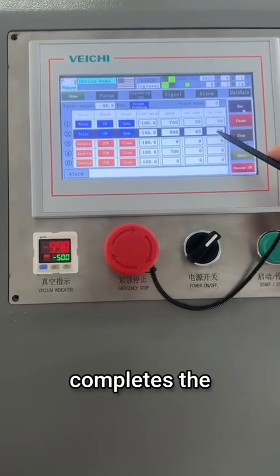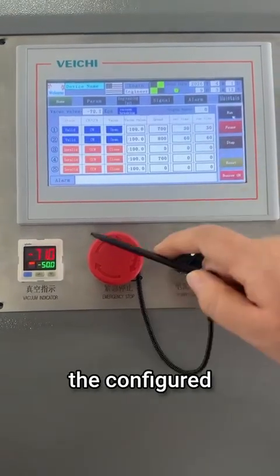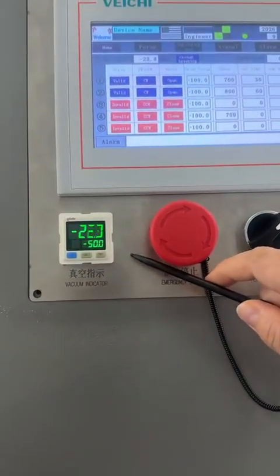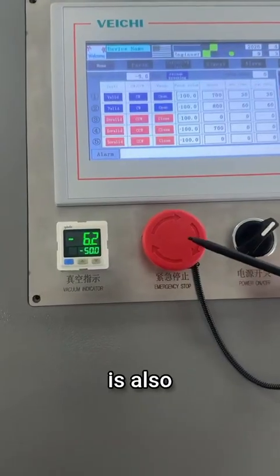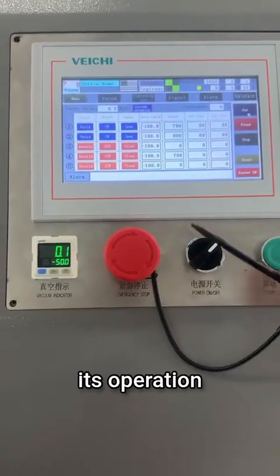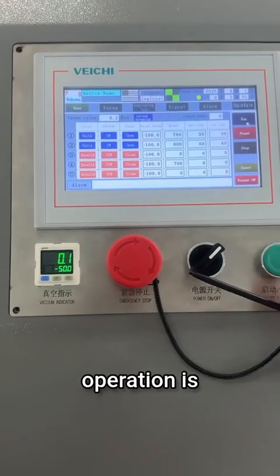Once the machine completes the preset program, it will shut down automatically, all according to the configured settings. The vacuum release process is also extremely fast. And then the machine finishes its operation. The alarm light will sound and the entire operation is complete.